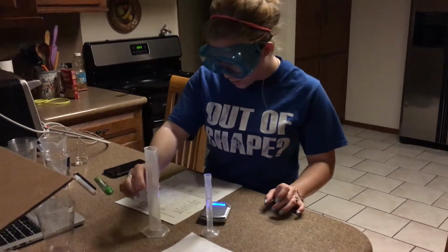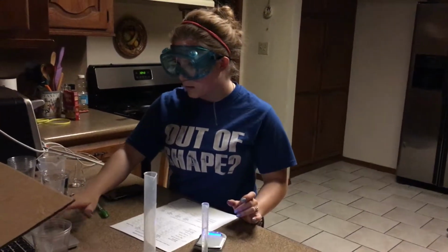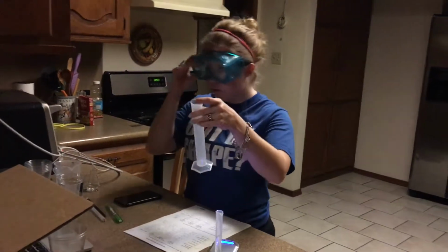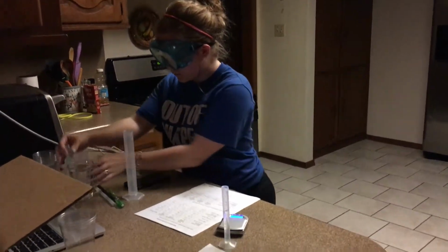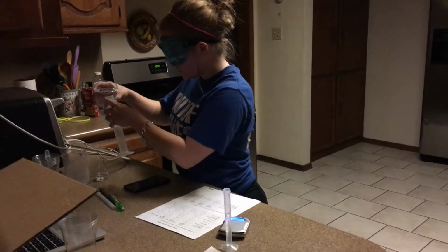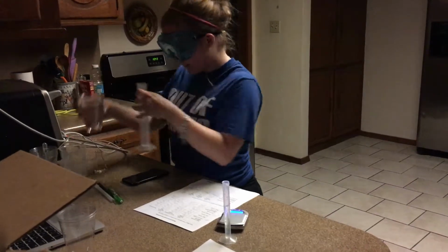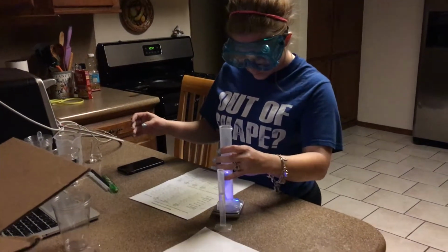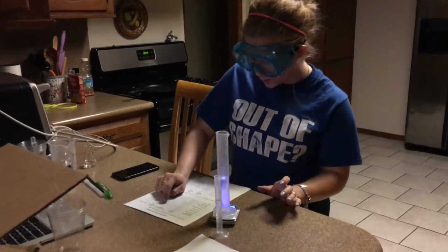Then I do the volume of water, and I want to say it said 24. So let me do this. Okay. Then I got 52.41 grams.